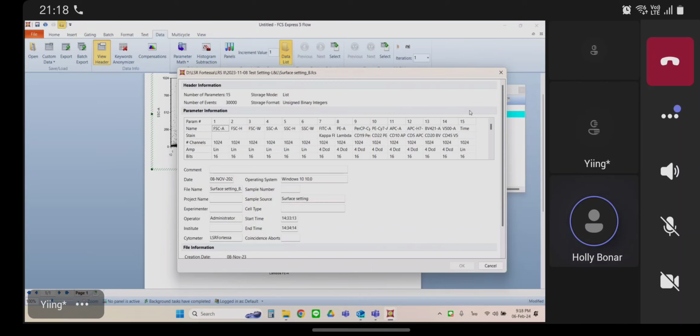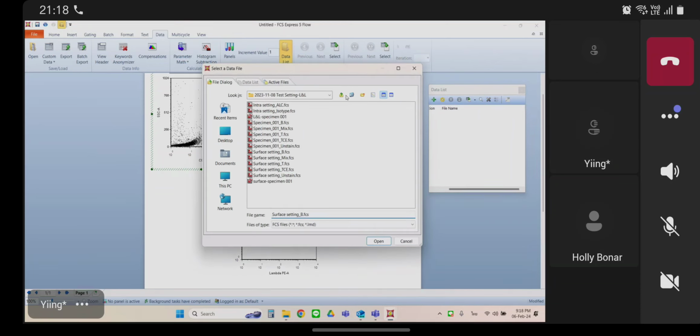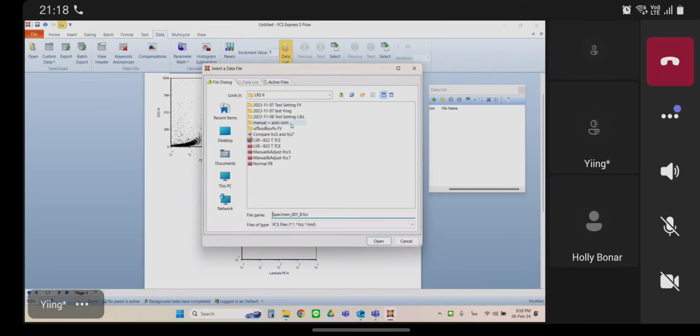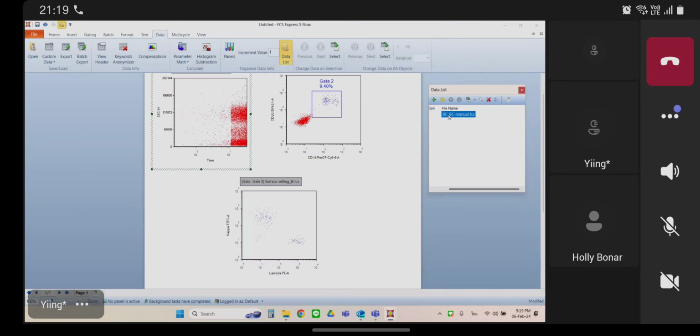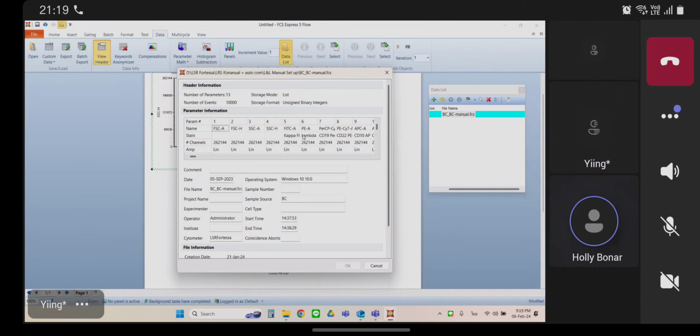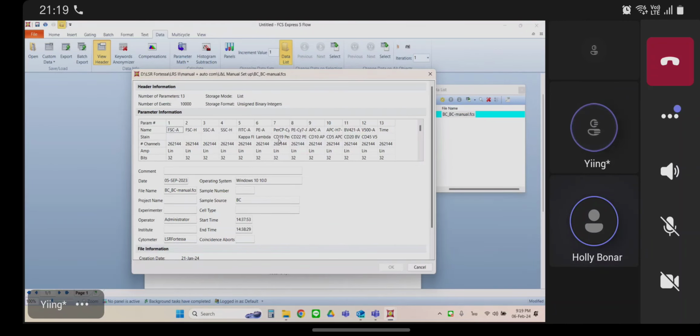So let's cancel that and go back to that other patient that you showed where it didn't work. Okay, so let's click on that plot and go back up to view header again. Okay, now see the parameters? There are not as many as before. So now you only have 4 scatter parameters, and kappa and lambda are 5 and 6 instead of 7 and 8.